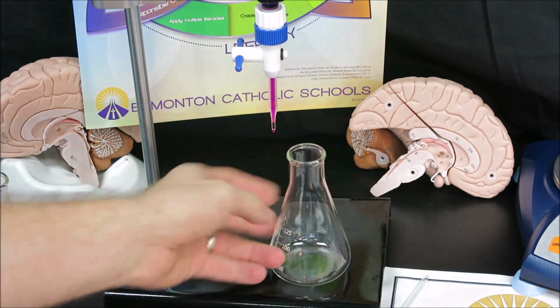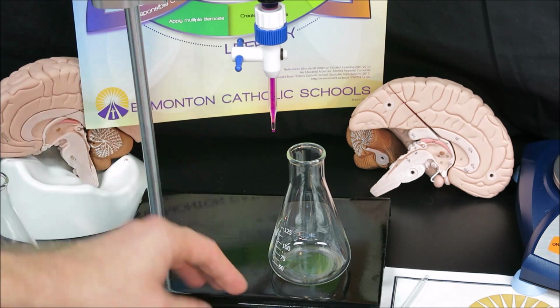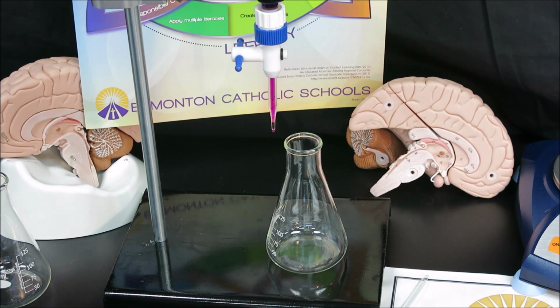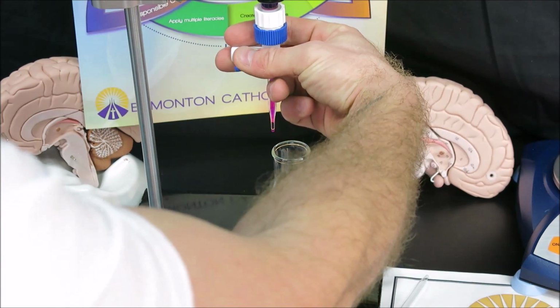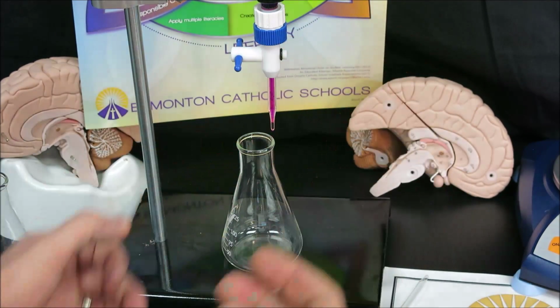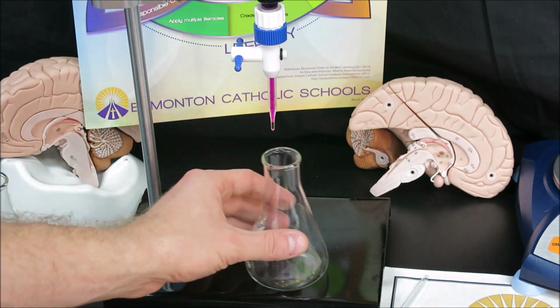You wait until you've reached the end point, which is the color change that indicates the equivalence point of the reaction. Try to remember that. End point is only a color change or an indicator that you've reached the equivalence point. And equivalence point, of course, is when the moles of the sample are equal in mole ratio to the moles of the titrant that you've added in. I have also seen people cross over and titrate across the burette like that, and then swirl with your left hand. Again, this is entirely up to you and your comfort level. I will leave it as this.